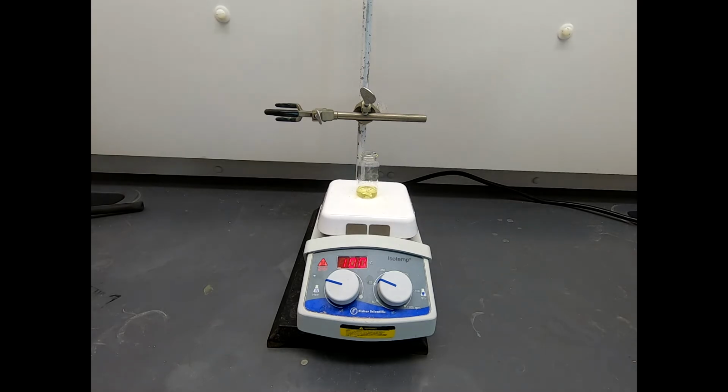So anytime you're in lab and you're working with super strong acids or super strong bases for that matter, always be careful. By all means, do wear gloves. Also notice that acid solutions tend to look like water, just like strong base solutions look like water. So it's easy to see droplets of liquid on the benchtop and assume that it's water because it looks like water. But in the end, you find out it's not water.